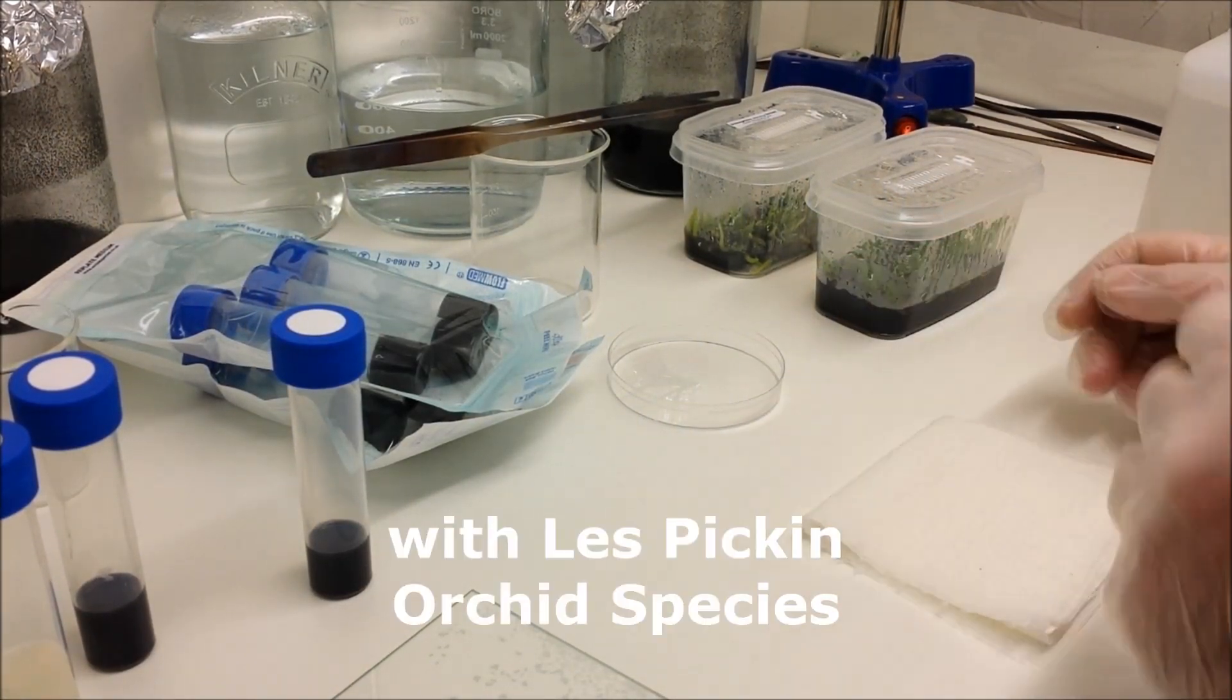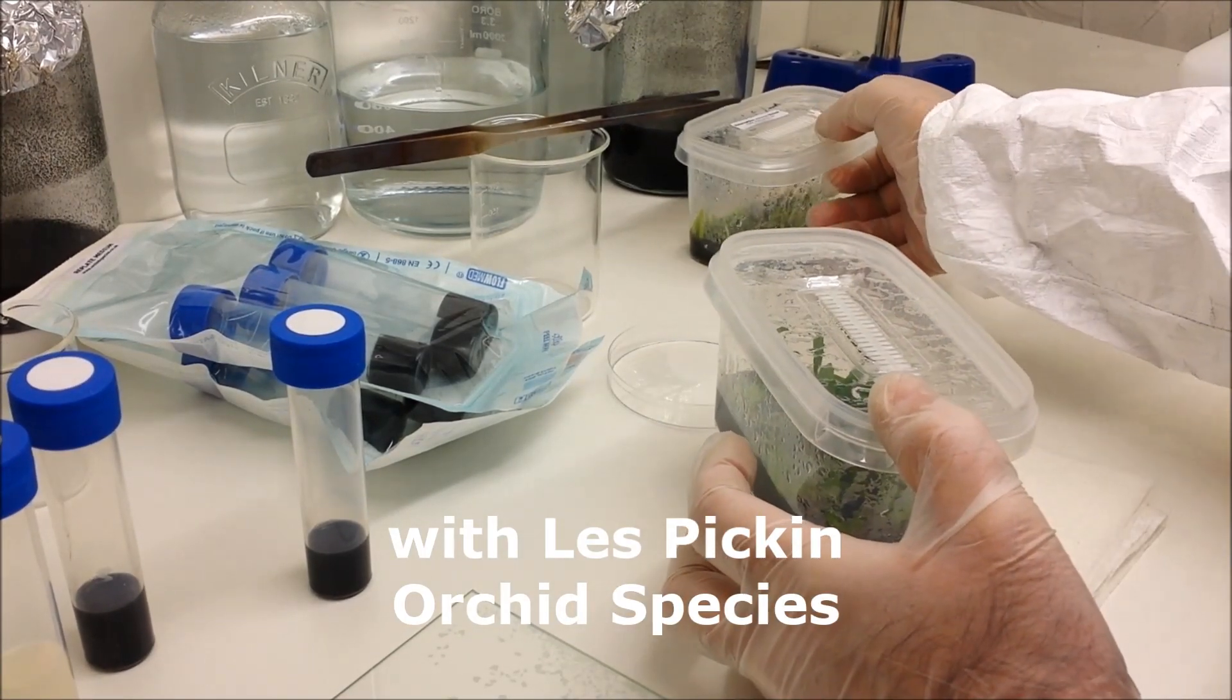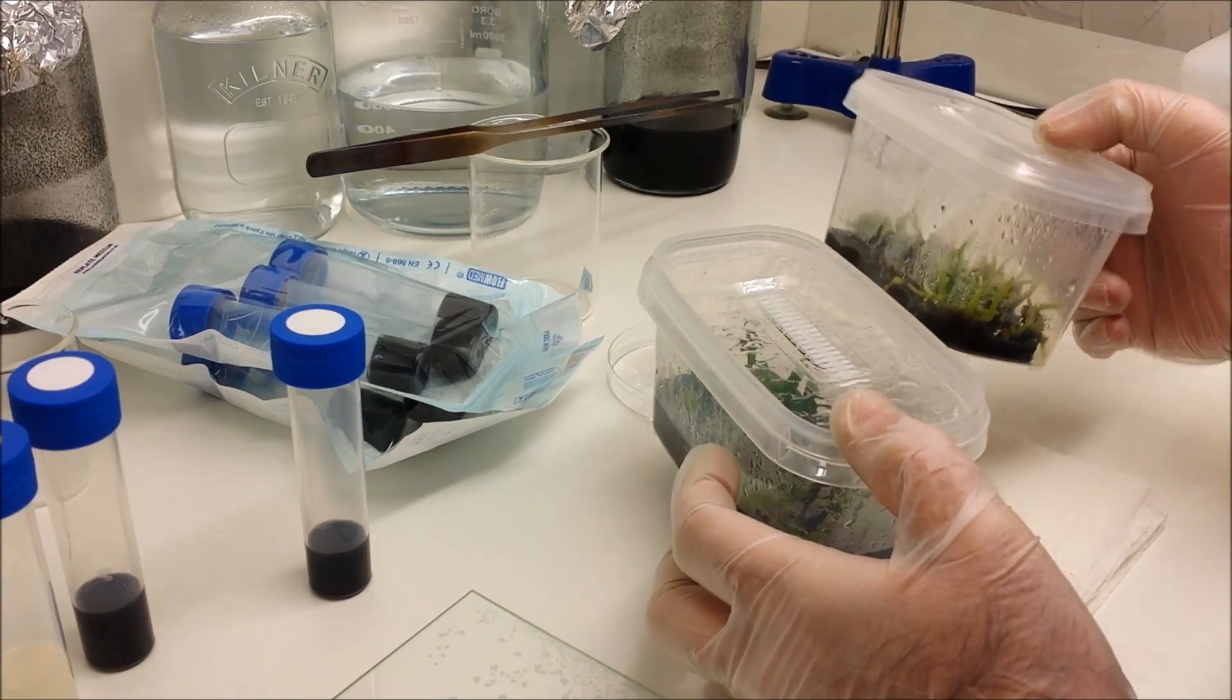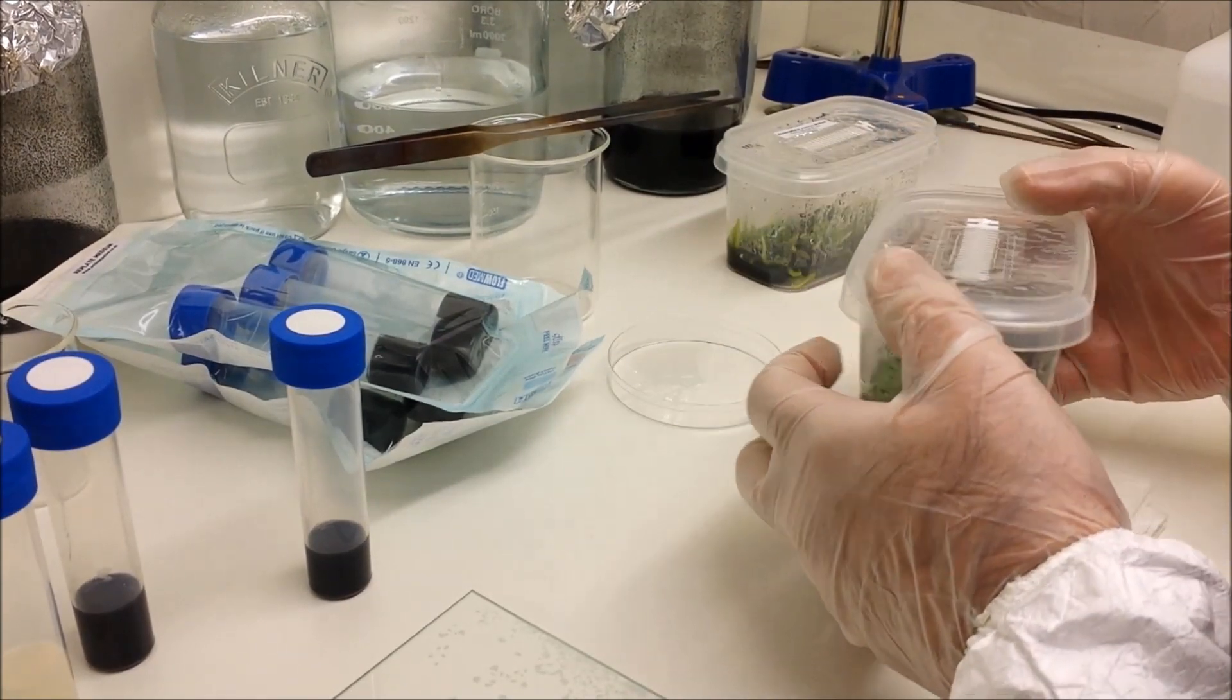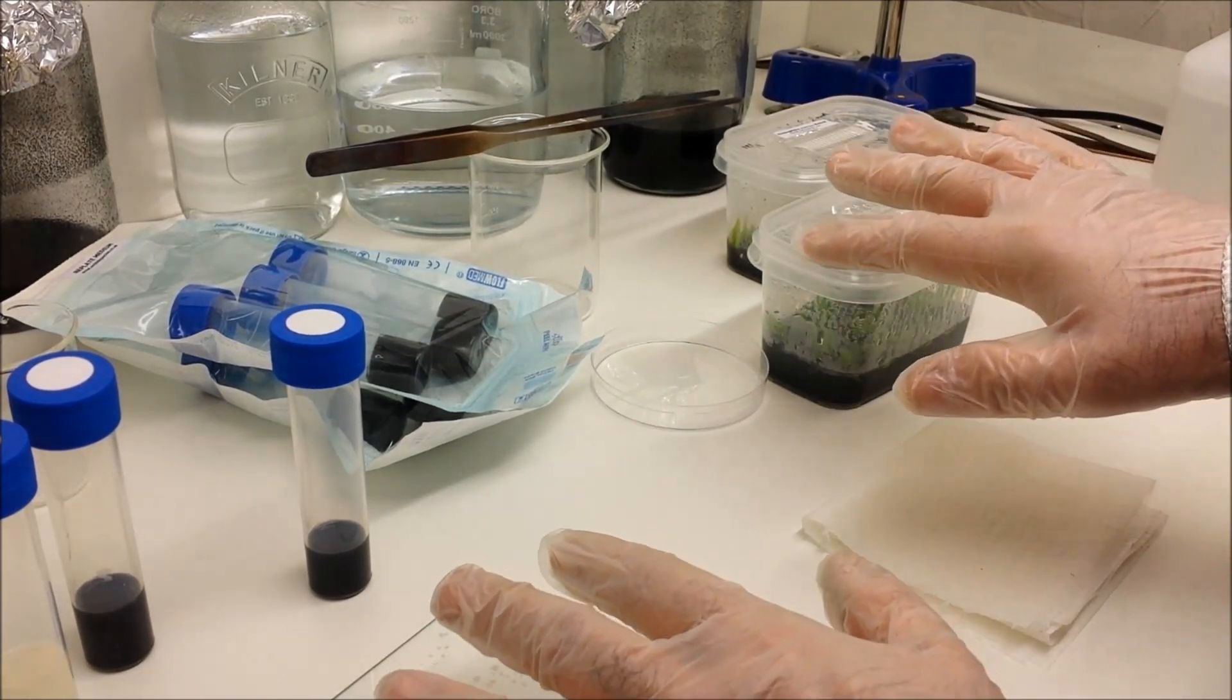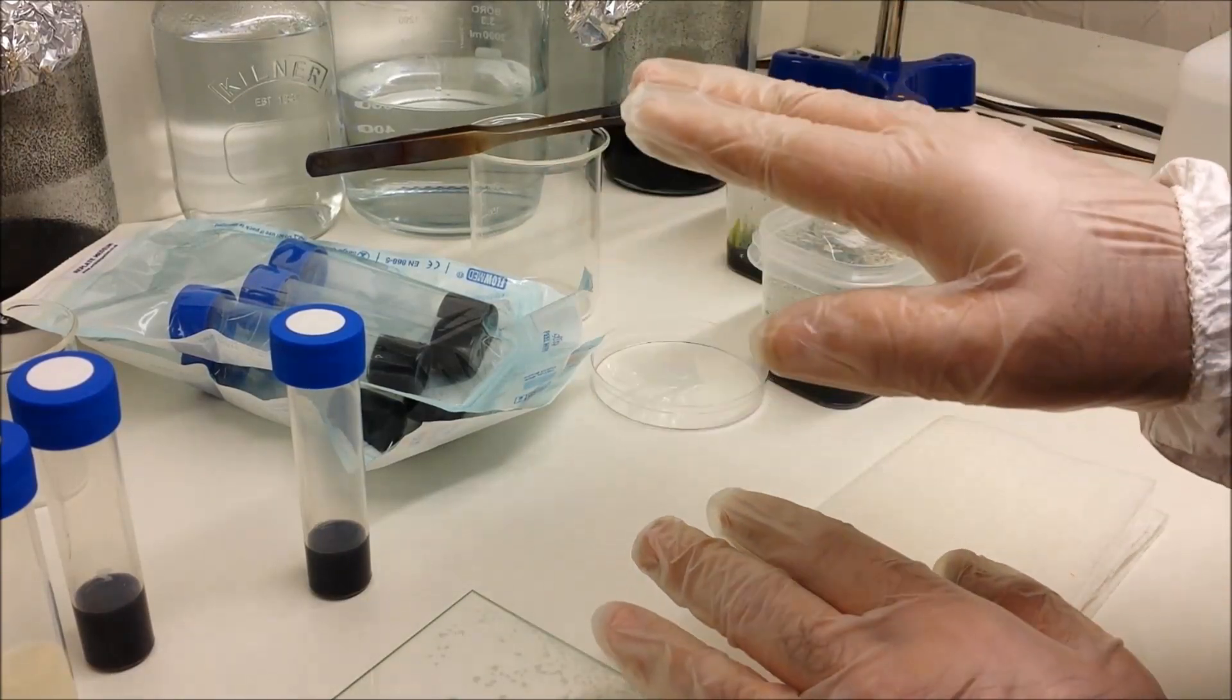Good afternoon folks. Today what we're going to be doing is replating or reflasking some orchid seedlings. In this case we're using Dendrophilax lindenii, which is also known as a ghost orchid, and also Aerangis decaryana from Madagascar.